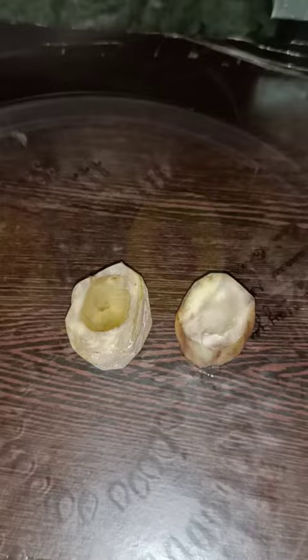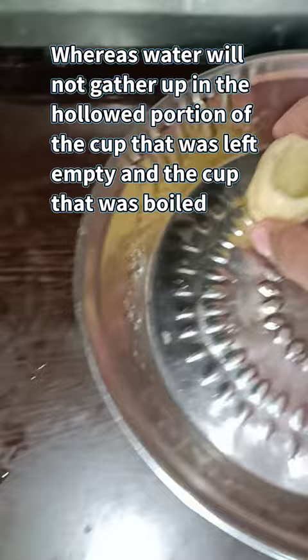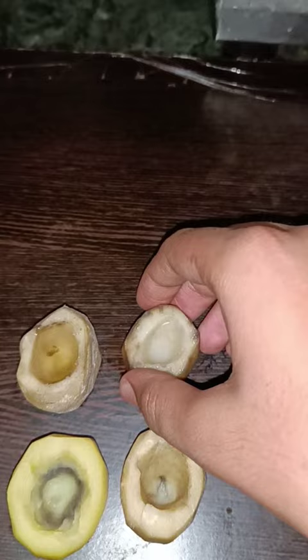Whereas water will not gather up in the hollowed portion of the cup that was left empty and the cup that was boiled. We may state that water gathered in the cups filled with sugar and salt because the inner surrounding of the potato cups became a hypertonic solution, as sugar and salt were present in it. Therefore the cells of the potato cups released water, which gathered in the hollowed portion of the cups.